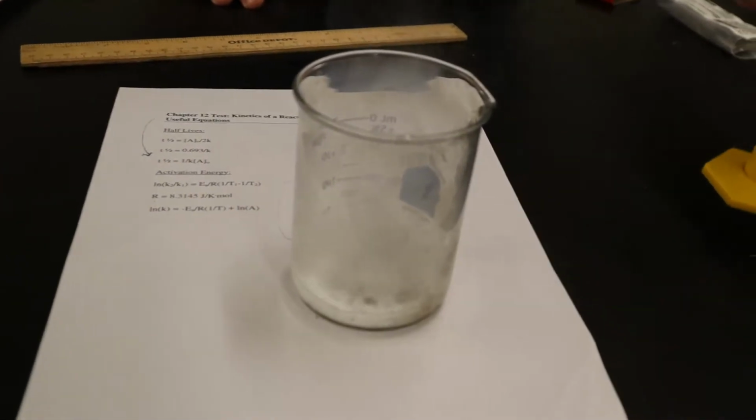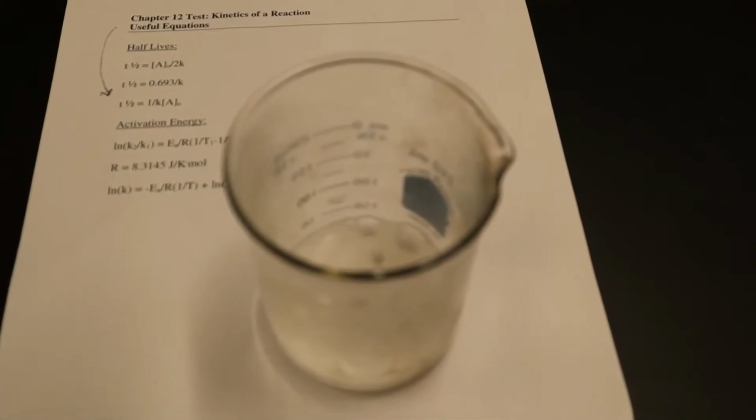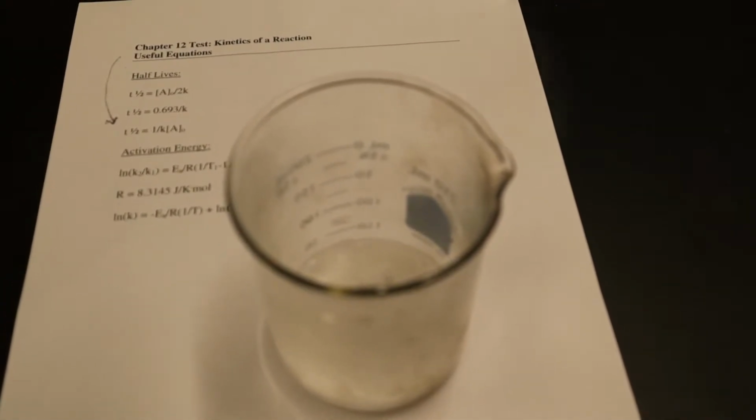Okay, you can see the acid is reacting. This is the single replacement reaction that's happening. The smoke, the bubbling, and the smell confirm that hydrogen gas is coming out of the container. And now we just have to wait maybe about 20 more seconds. Just wait for everything to calm down, all that fizzing and bubbling.